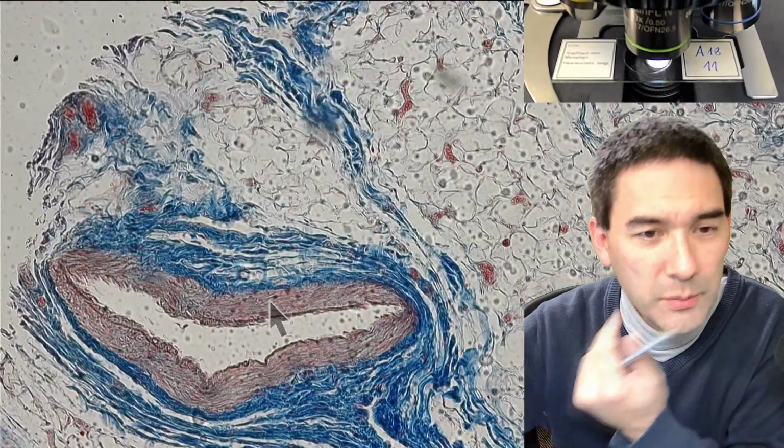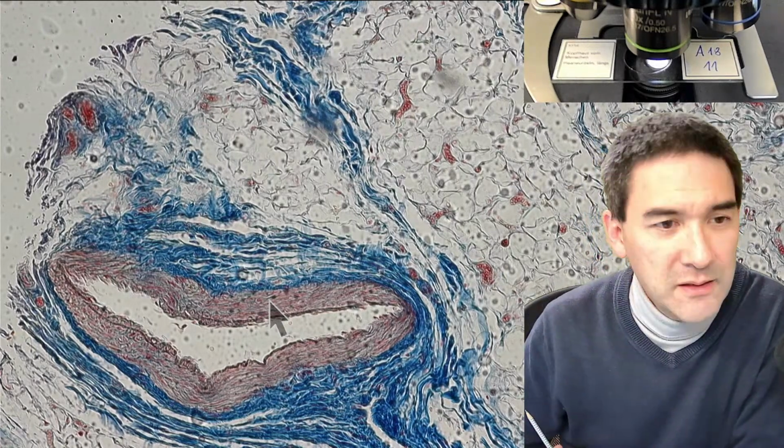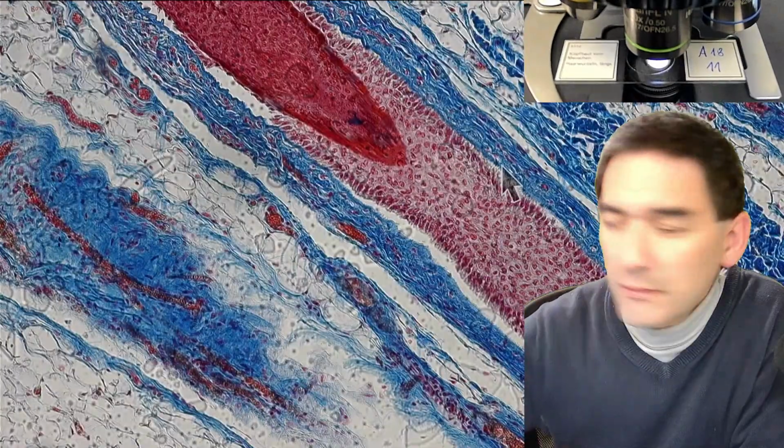This one here looks very much like a blood vessel over here in the tissue. Many of the cells in here that are so white very often are adipose cells, basically fat cells. They do not pick up the stain very well. So maybe it's better to go down with the magnification a little bit because it simply gives you a better overview.